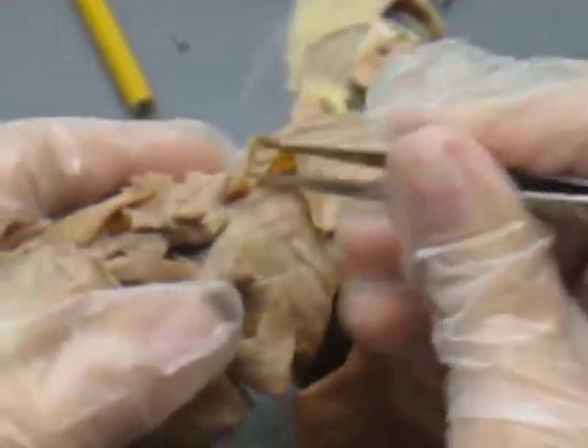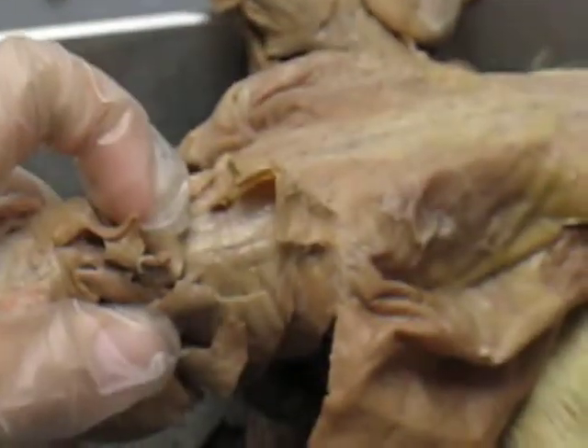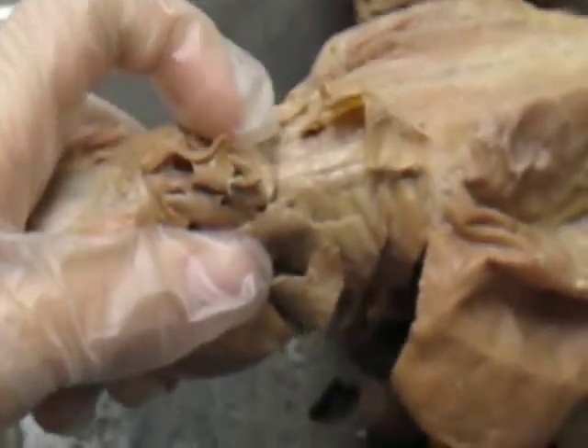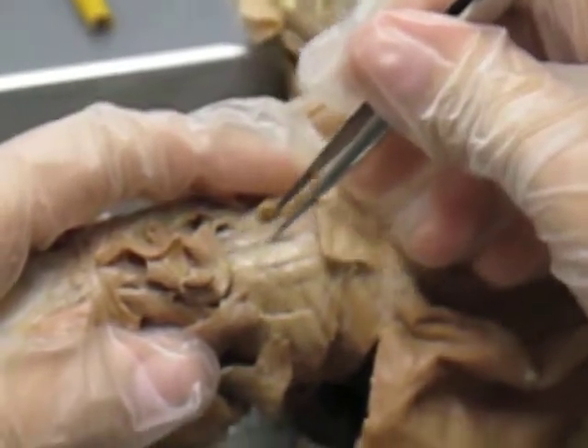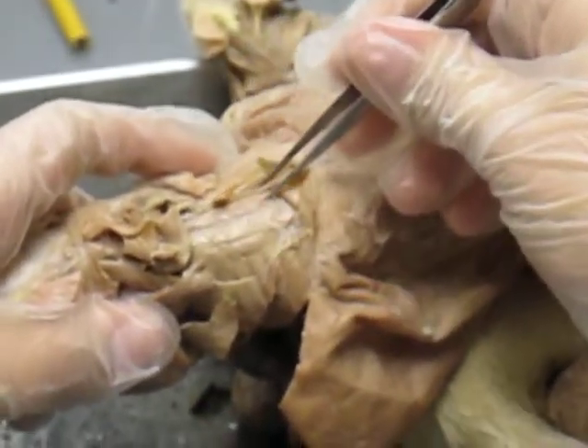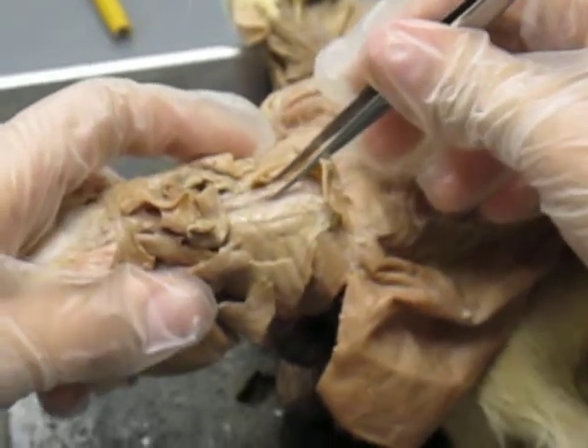It's just connective tissue. A thing that's not in here, but is in your printout that you had to print out from online — you have two rows of really thick banded muscle running along the back. That's your erector spinae.